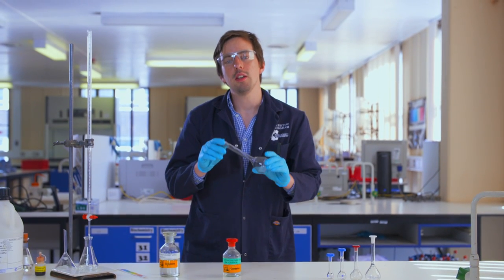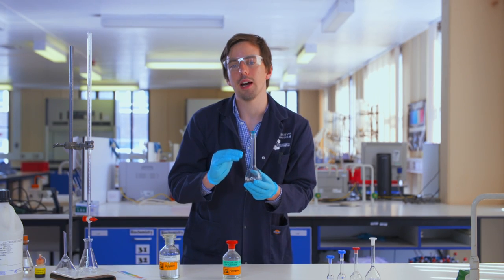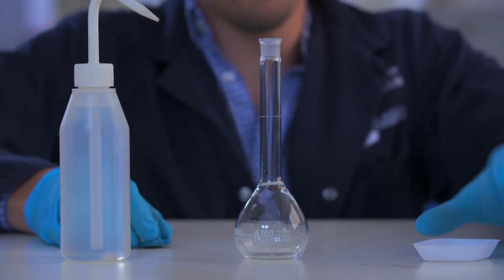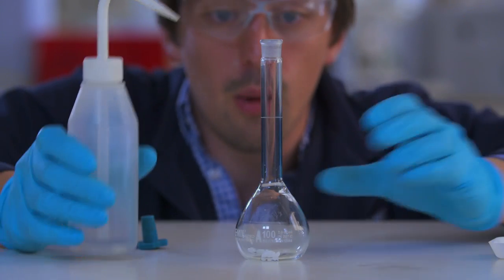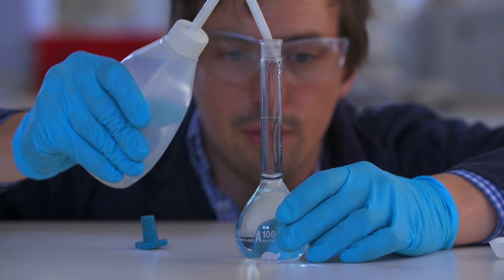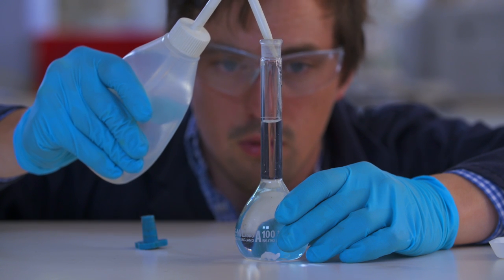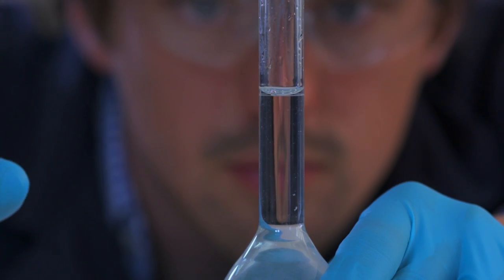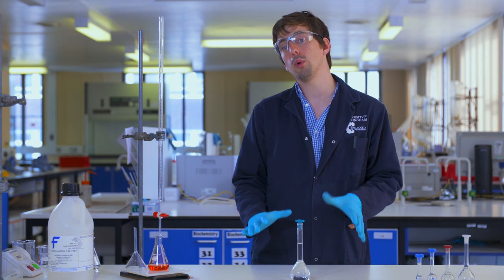To make a standard solution, we take this volumetric flask — it's shaped with a large bulb at the bottom and a narrow stem so that I can more accurately add the right amount of liquid. I'm going to add a weighed amount of sodium hydroxide to this flask and then fill it up to the mark with deionized water. Since the neck of the flask is so narrow, a small amount of volume will make a large difference to the height of the meniscus. The bottom of the meniscus should rest perfectly on the bottom of the mark. We have made our standard solution of sodium hydroxide and we know that the concentration is 0.5 molar.